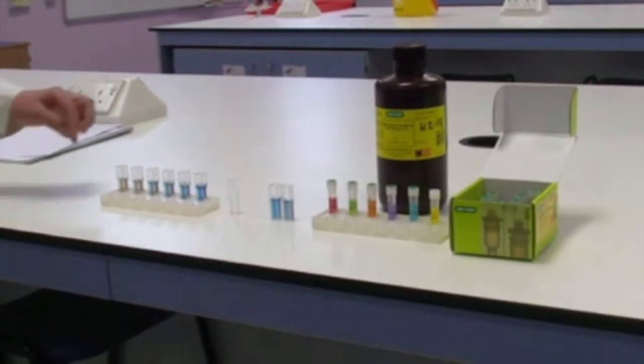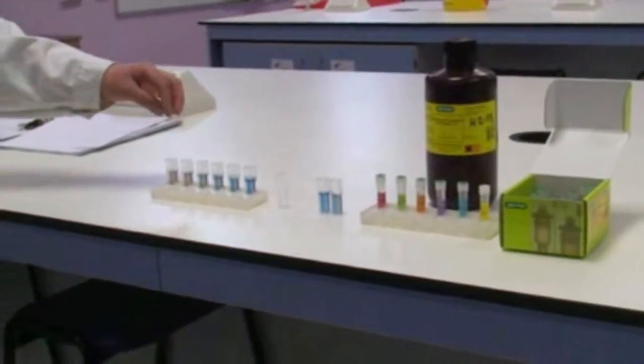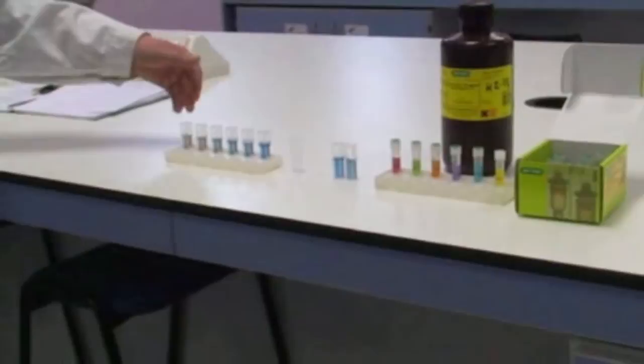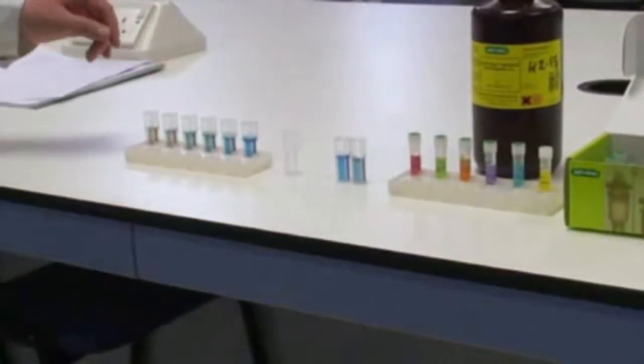Then you pipette your standards at a range of concentrations and add 1 ml of Bradford Reagent to each cuvette. So here you have your range of standards already prepared to measure with the spectrophotometer.